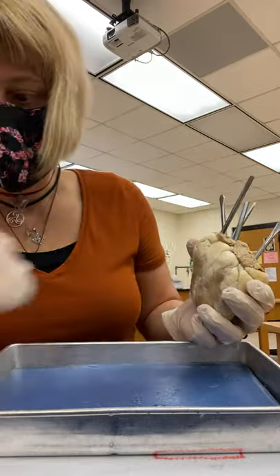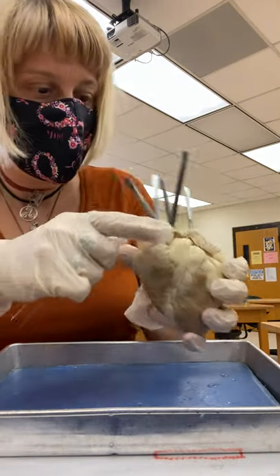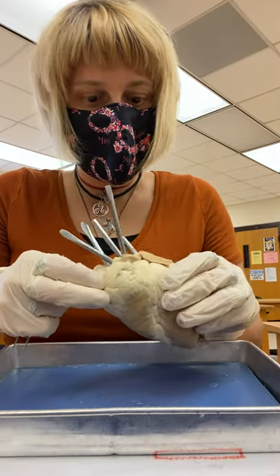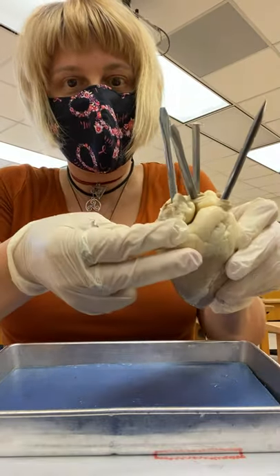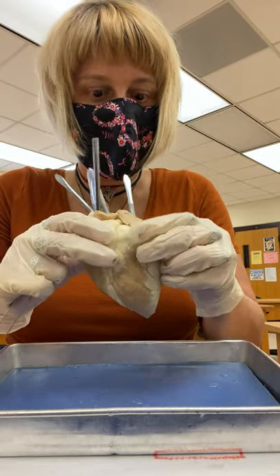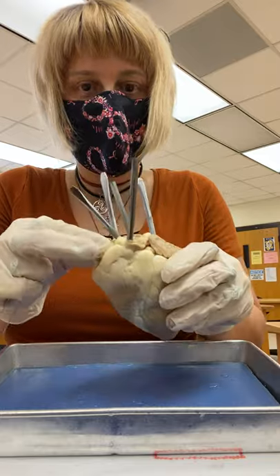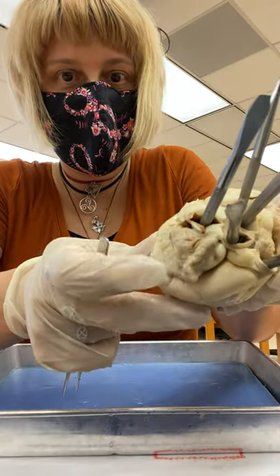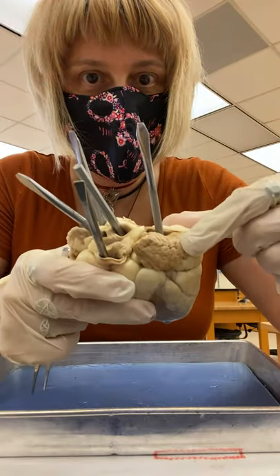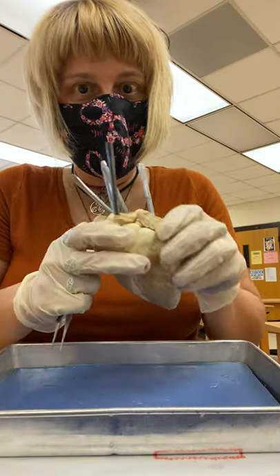So let's begin with identifying structures. The first thing is to be able to identify the right side from the left side. You can see the right auricle — so this whole side here is the right side, and therefore this is the left side. Right auricle is on top. Left auricle right there. And there's your apex.